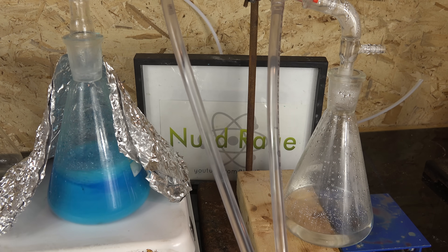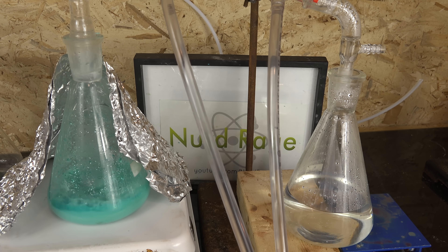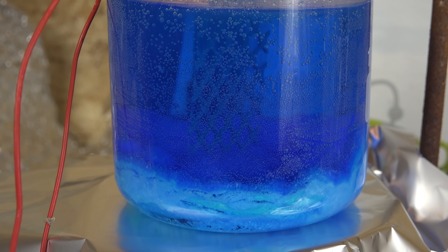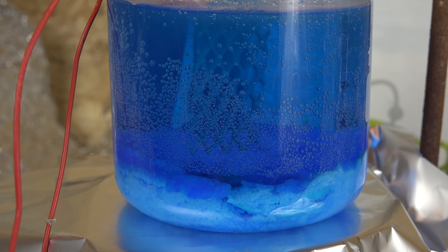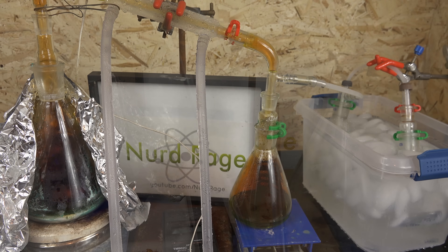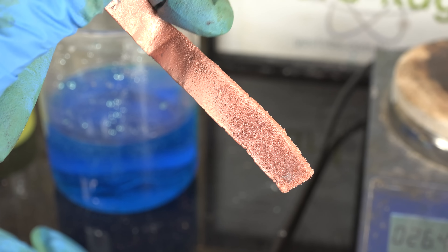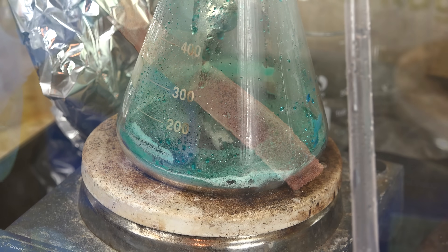There is actually. The overall idea is to react copper nitrate with sulfuric acid to produce nitric acid and copper sulfate, then electrolyze the copper sulfate to recover our copper metal and sulfuric acid again. The whole process is very efficient and much better than having to deal with the toxic nitrogen dioxide gas as in the thermal decomposition method. You can not only recover the nitric acid but also the copper as well. You just need a platinum electrode and some sulfuric acid, but both are reused. So let's get started.